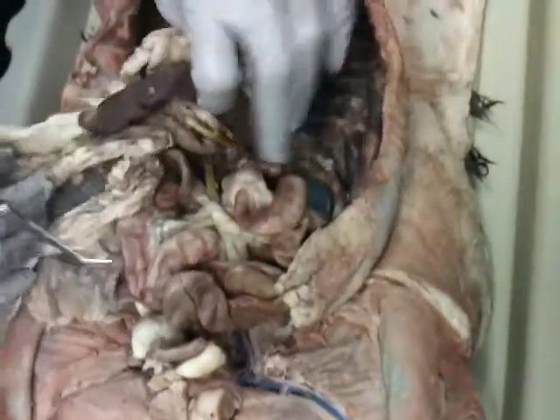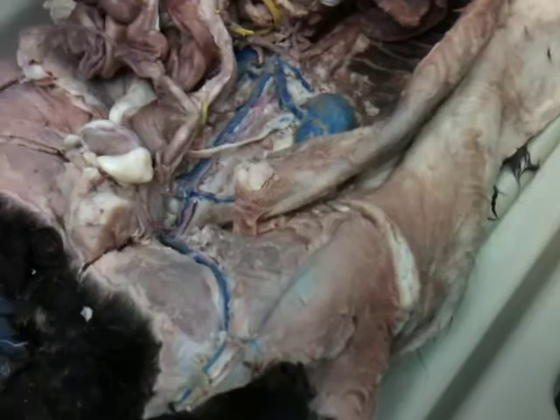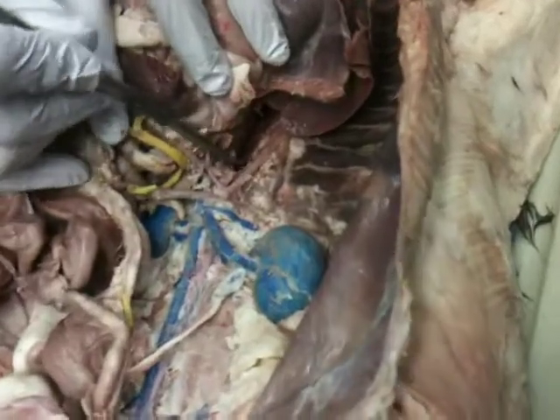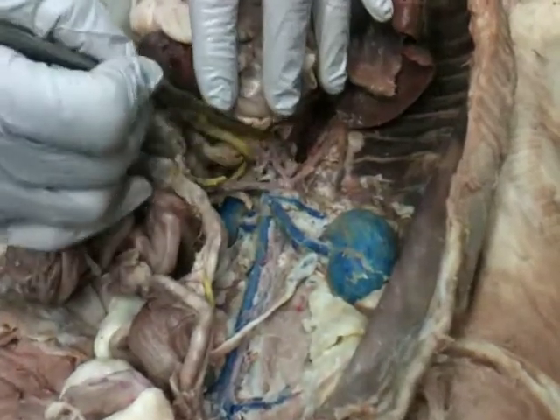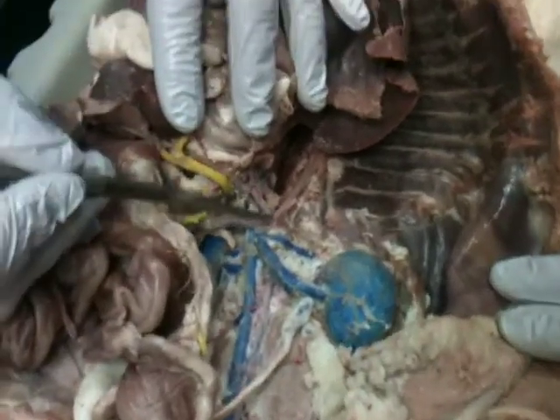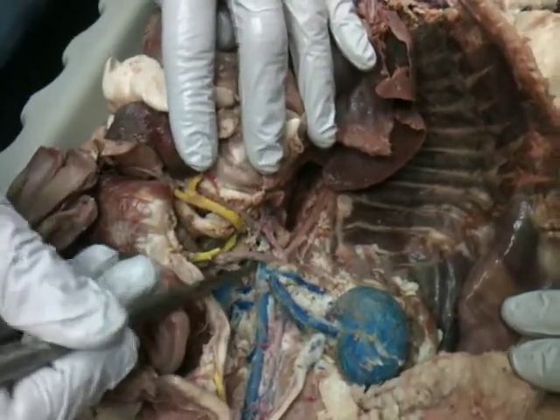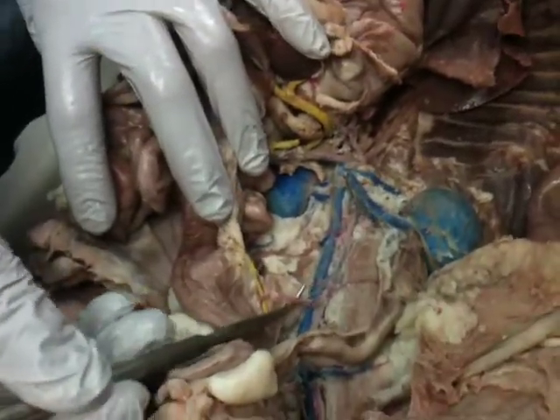Okay, many of the arteries and veins are found in here. Here we go. So let's take a look at the arteries. First of all, find your large arteries, kind of figure out where you are. And the abdominal aorta is the big one of the abdominal area. Abdominal aorta goes all the way down. And it has three main branches off of it, kind of like a backward K up here. We have the celiac, we have the superior mesenteric, and down here we have the inferior mesenteric arteries.